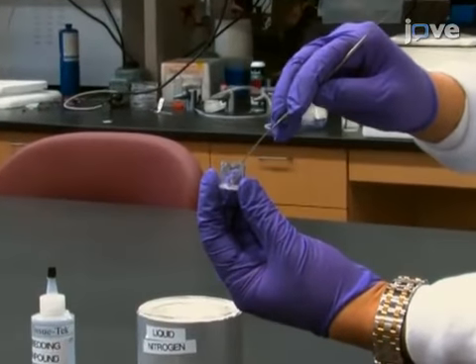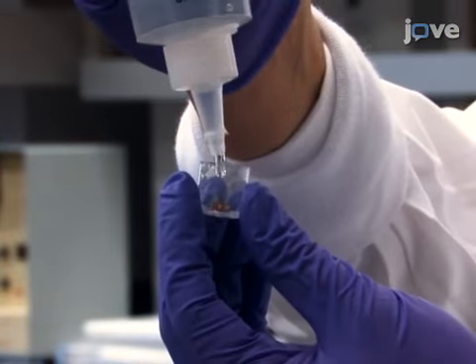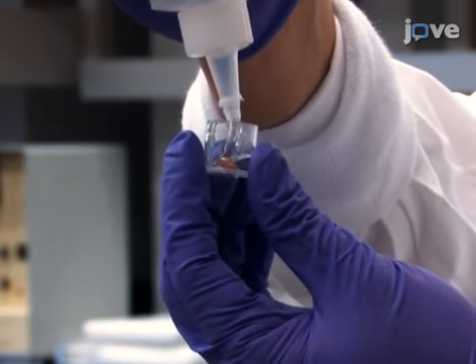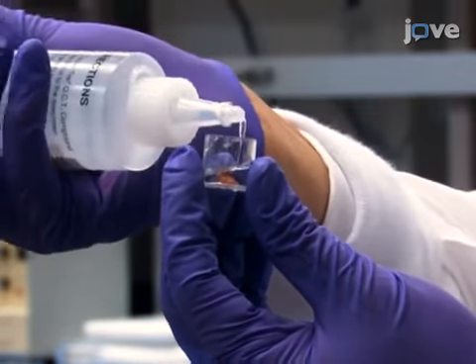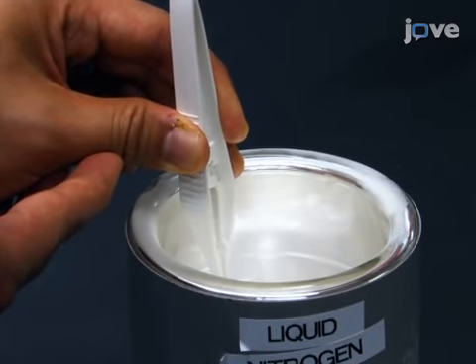Place a whole mouse organ of interest into the center of a small plastic well. Submerge the organ in tissue embedding compound up to a height of about 10 millimeters. Immediately place the tissues into liquid nitrogen for flash freezing.